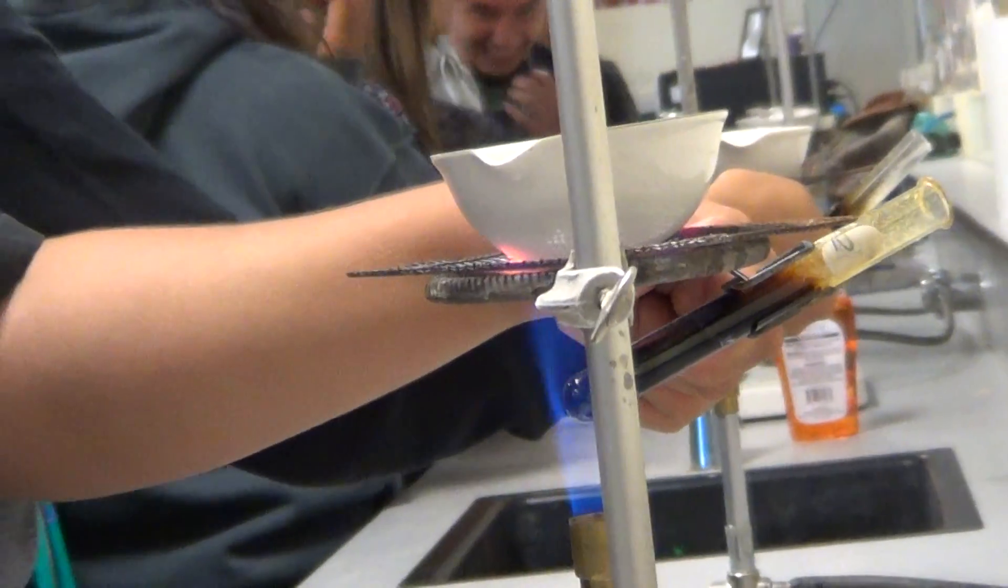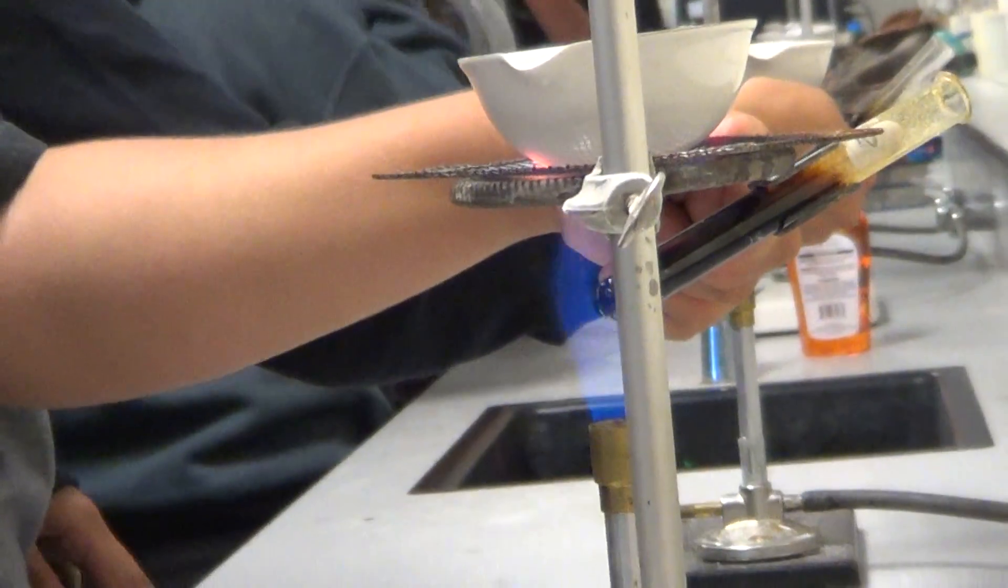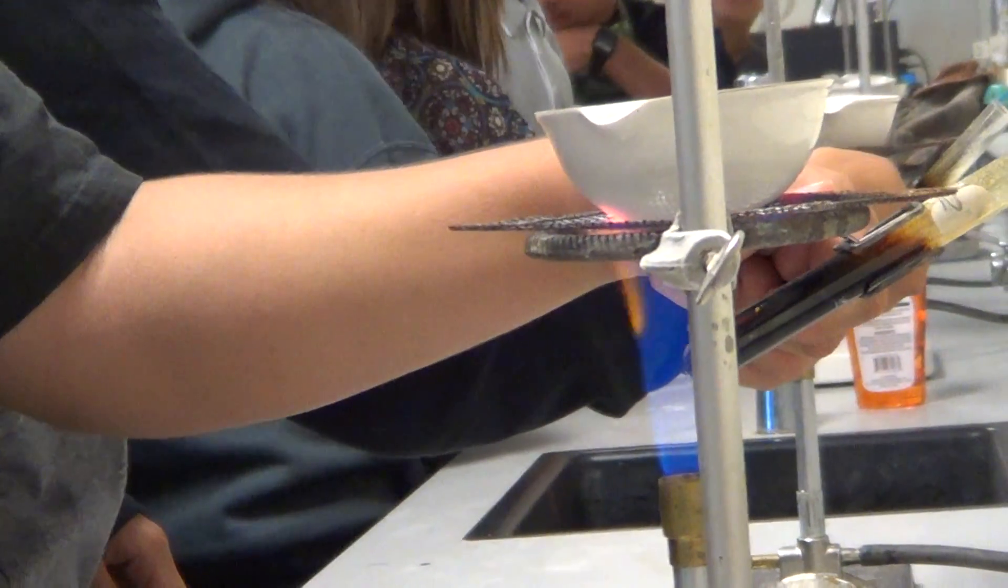Look at me, I'm doing science. Yeah, that'll be it. The flame's going through. It's scaring me.